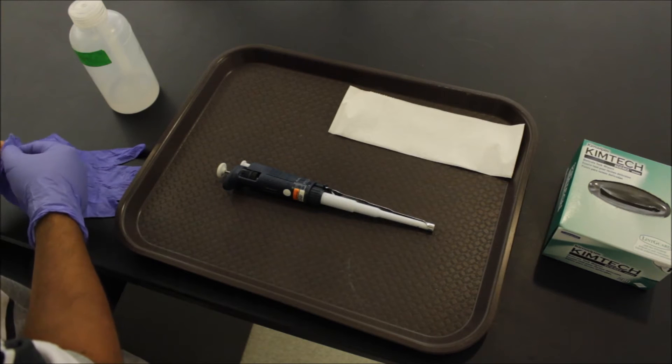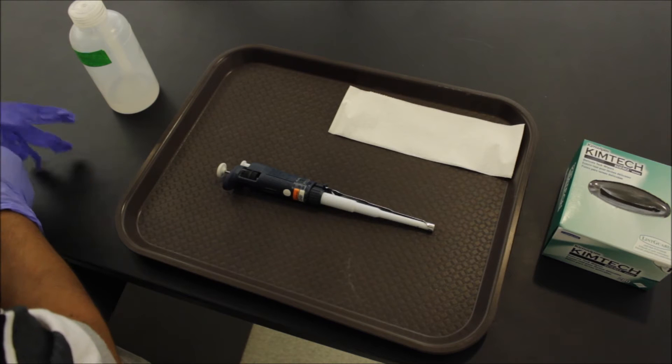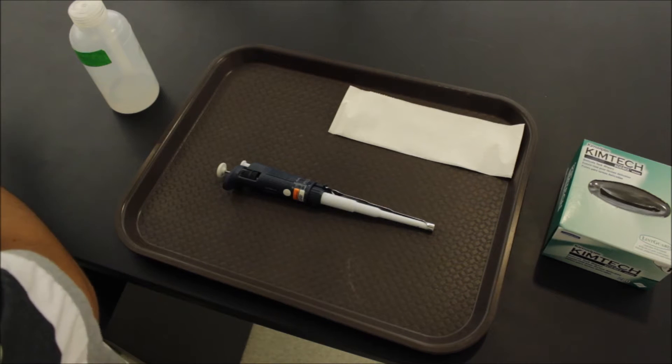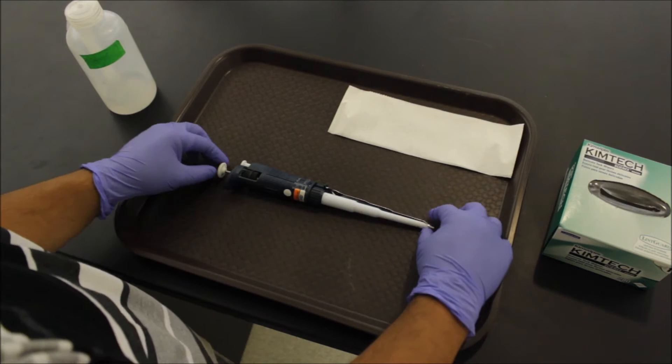Always wear gloves and keep your ethanol in hand. Since the Gilson and Finn pipettes are pretty much the same in assembly and disassembly, we're just going to go through with the Gilson real quick.